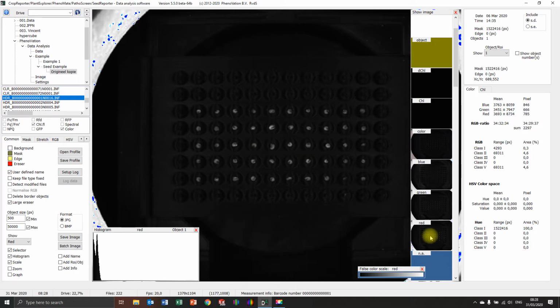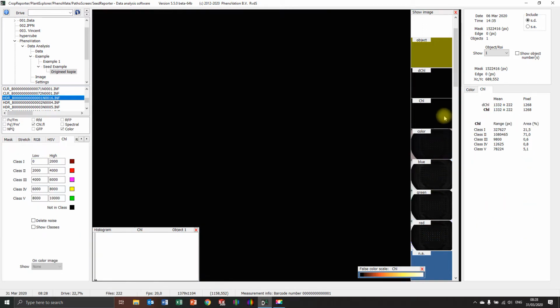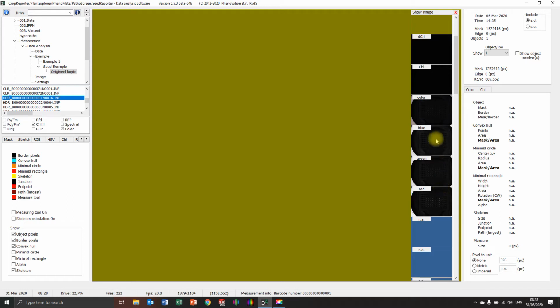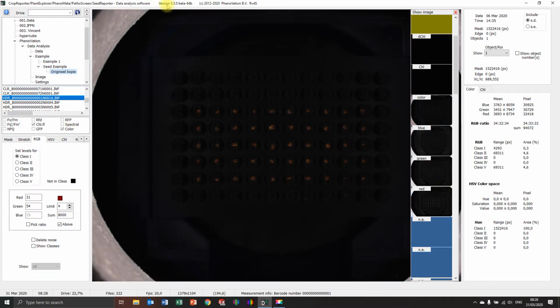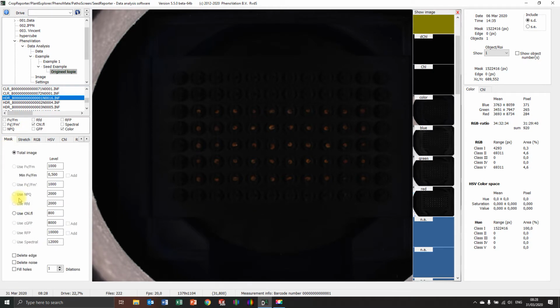As you can see, I can see a color image, so also red, green, blue, and color. I can see those, but chlorophyll is dark. I don't see any objects. But you still see the entire picture. You can see everything. So in this case, I know there's no mask. You can see it's on total image.